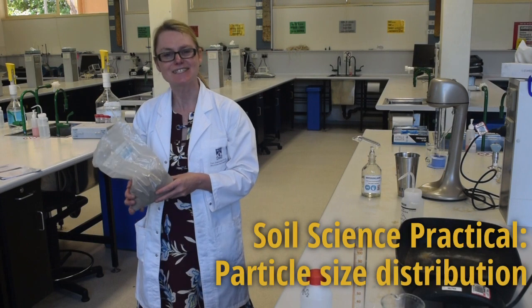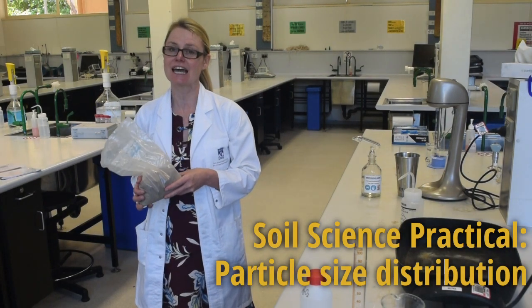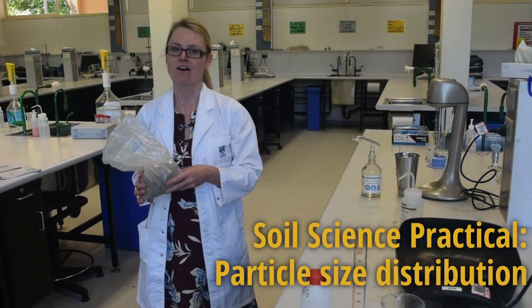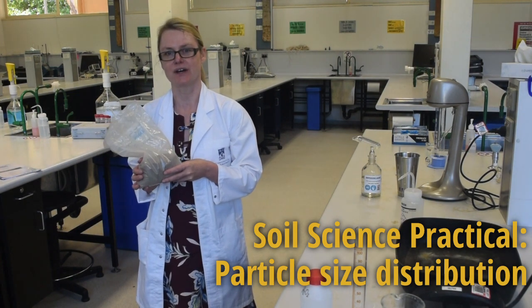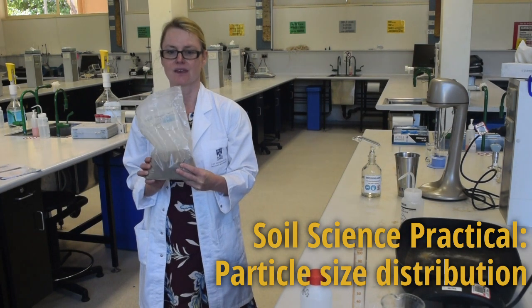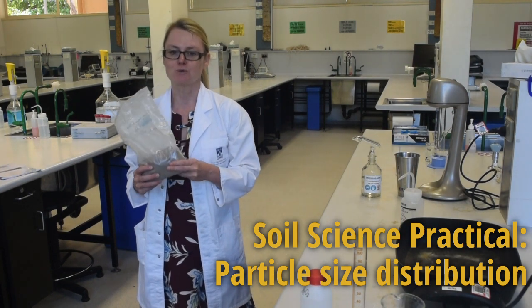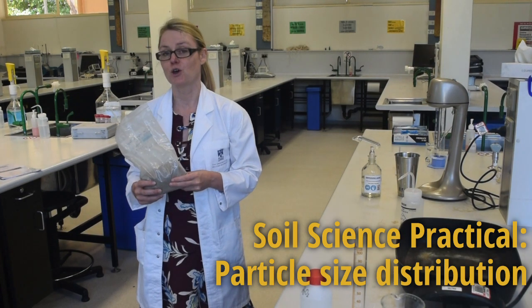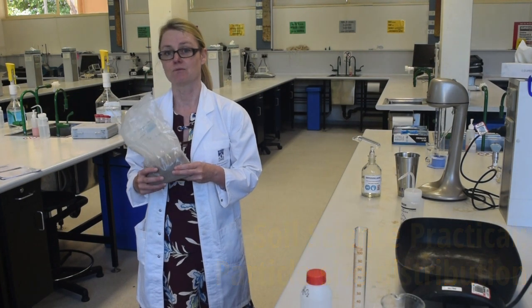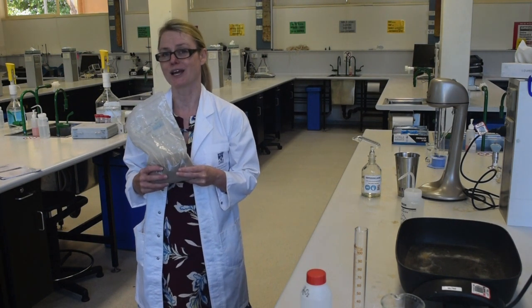Hi everyone. In this week's lab you're going to be determining the percentage clay, silt and sand of your particular soil horizon using your composite soil sample. By using the particle size distribution results you'll then be able to determine the soil texture of your horizon, whether it's a sandy loam, a loam, or a clay.